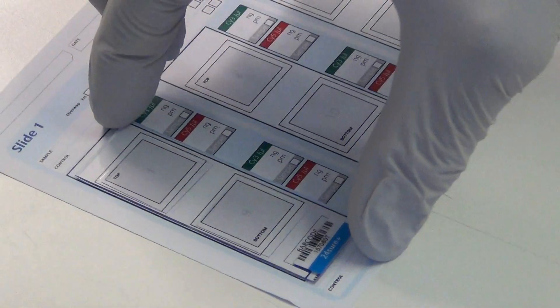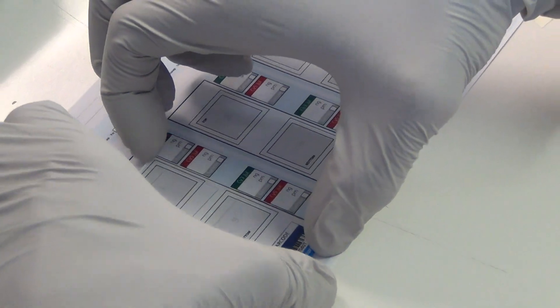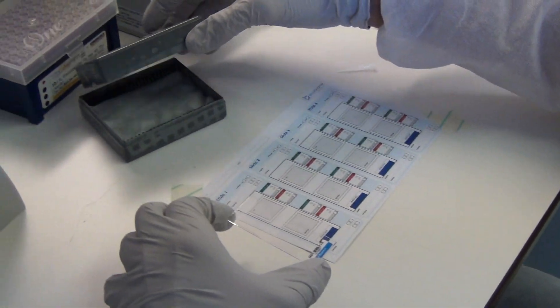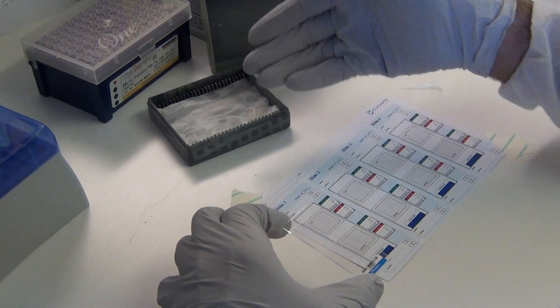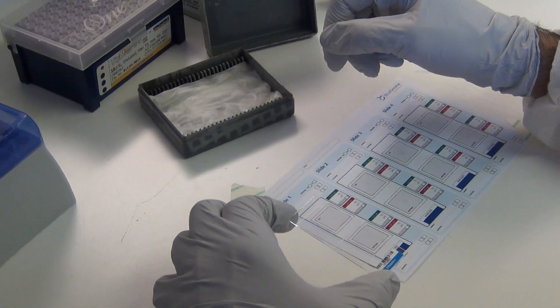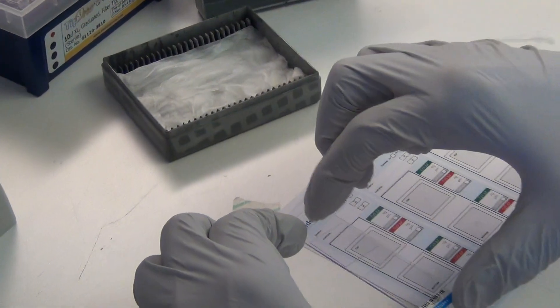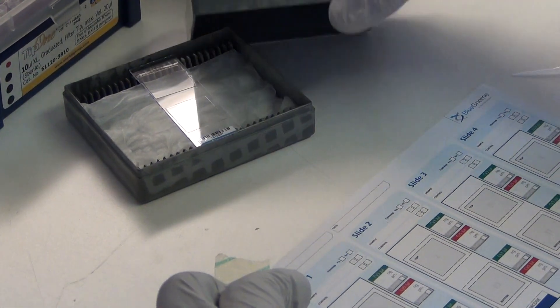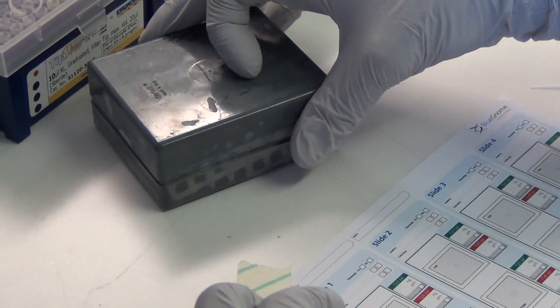The array slide is now placed in a pre-prepared humid chamber that will be sealed tight and incubated in a preheated water bath.